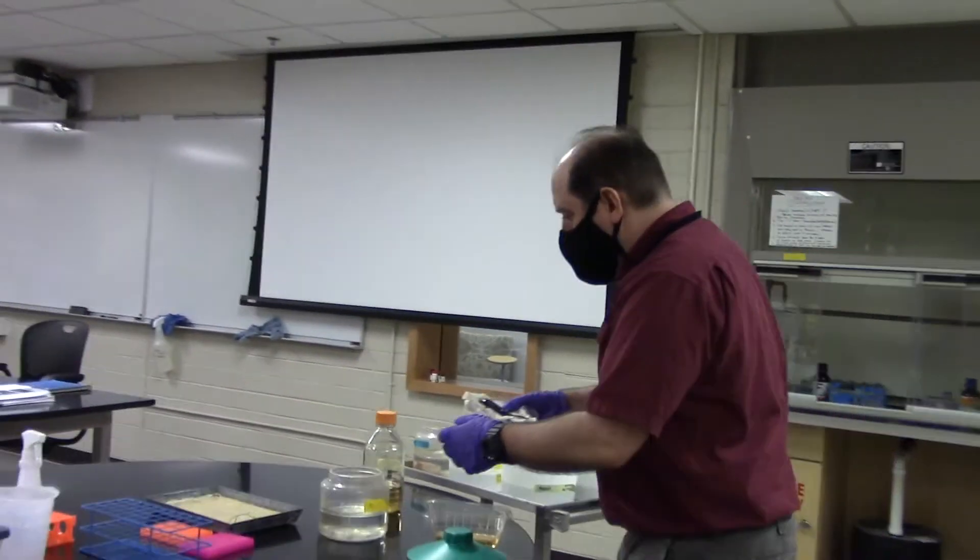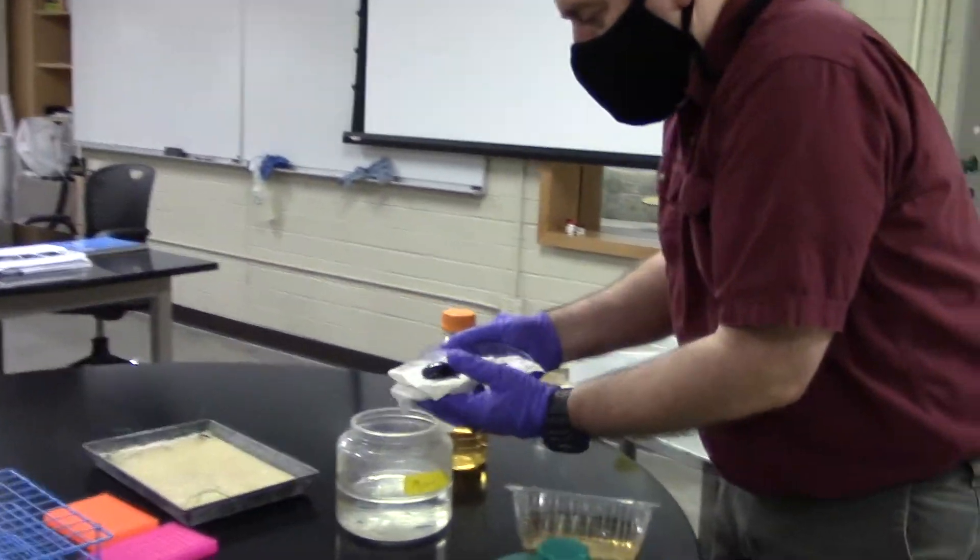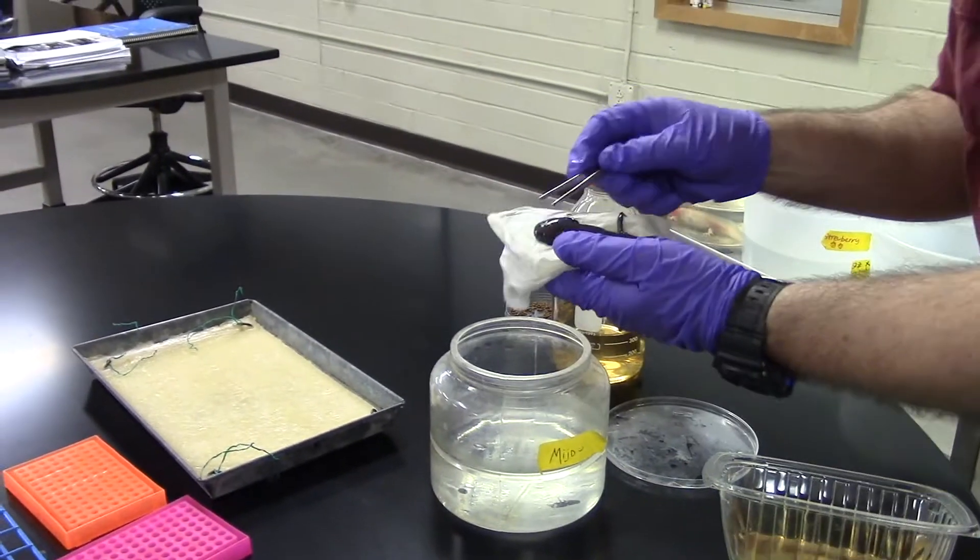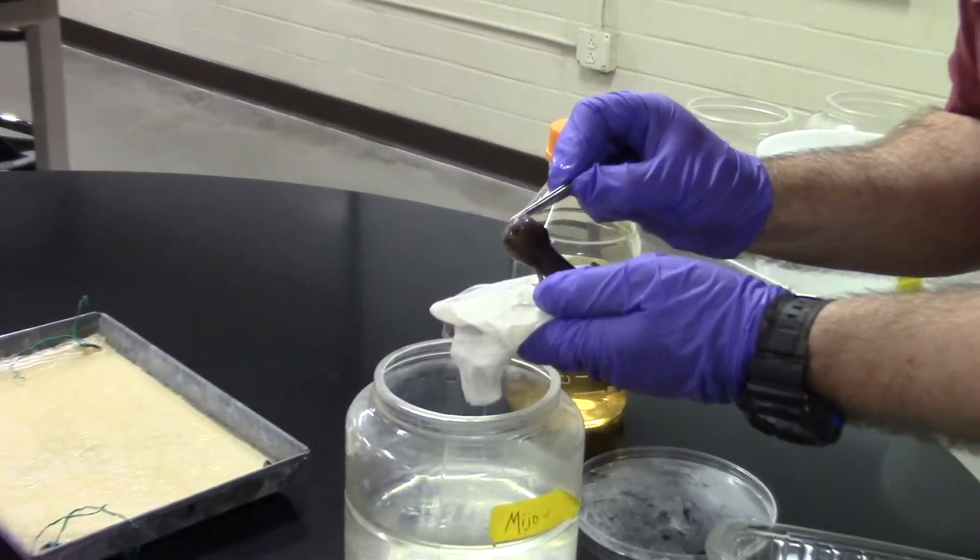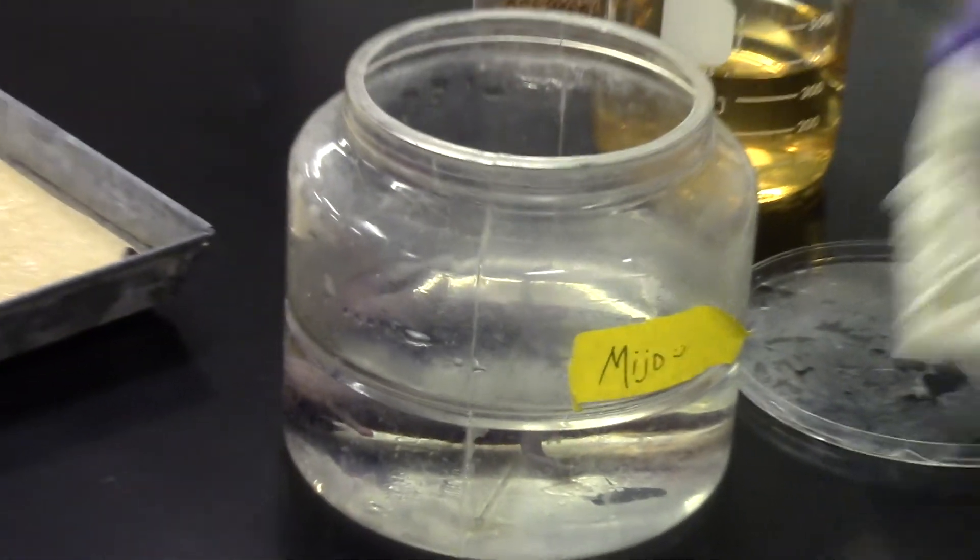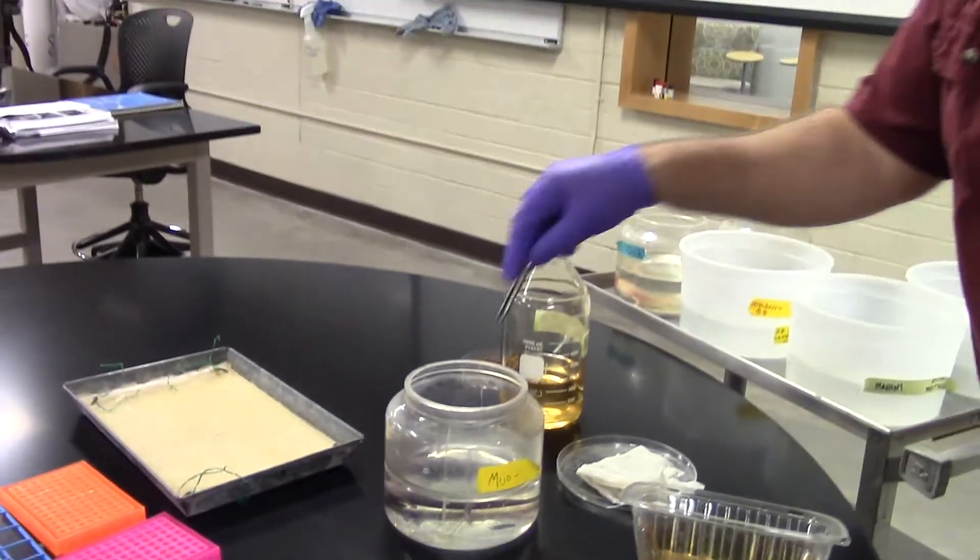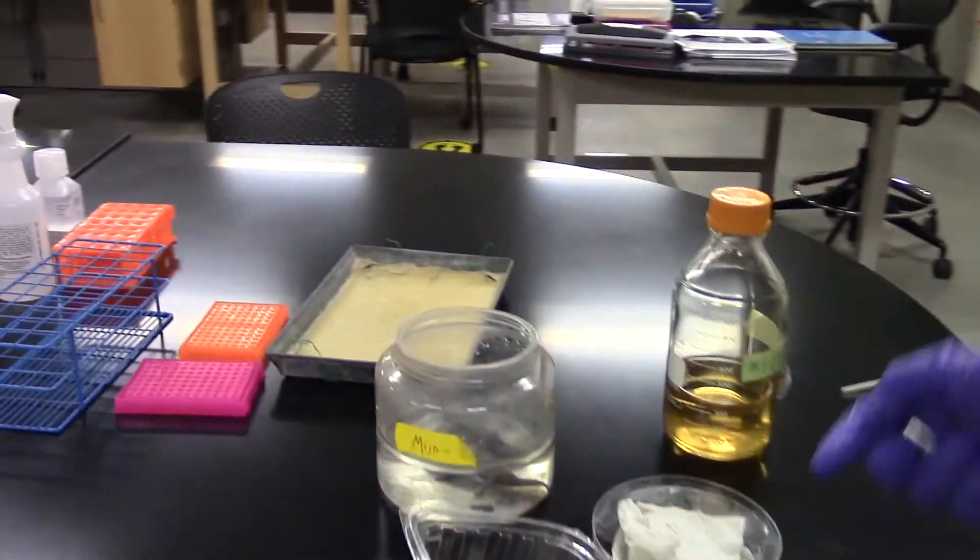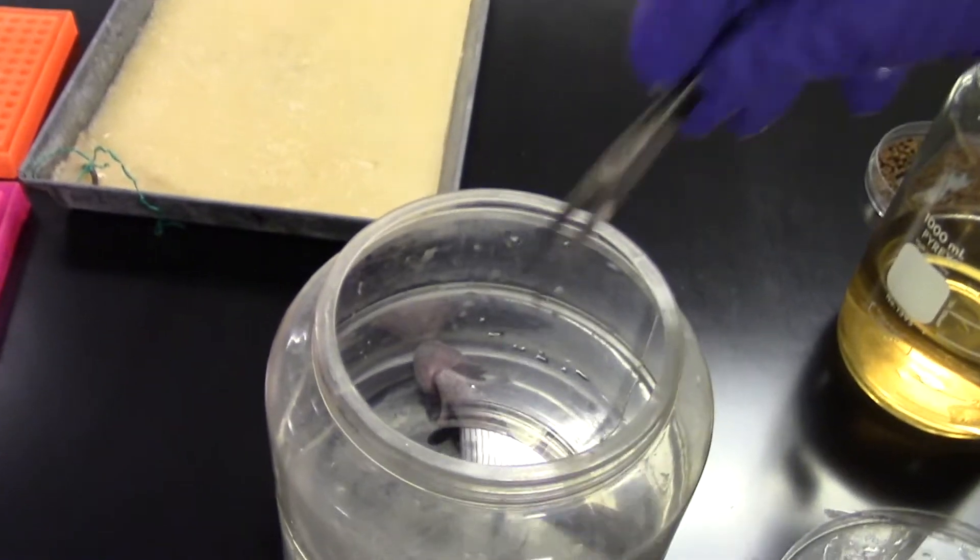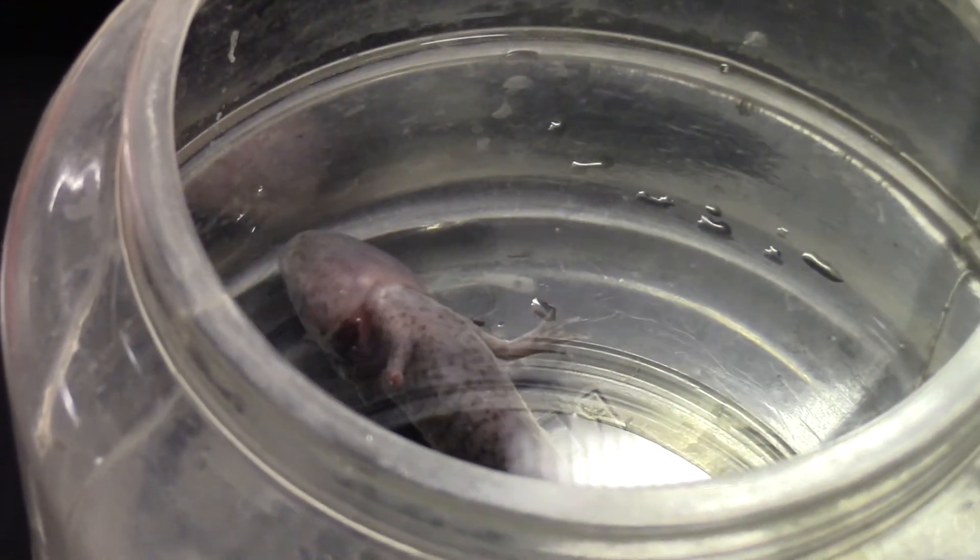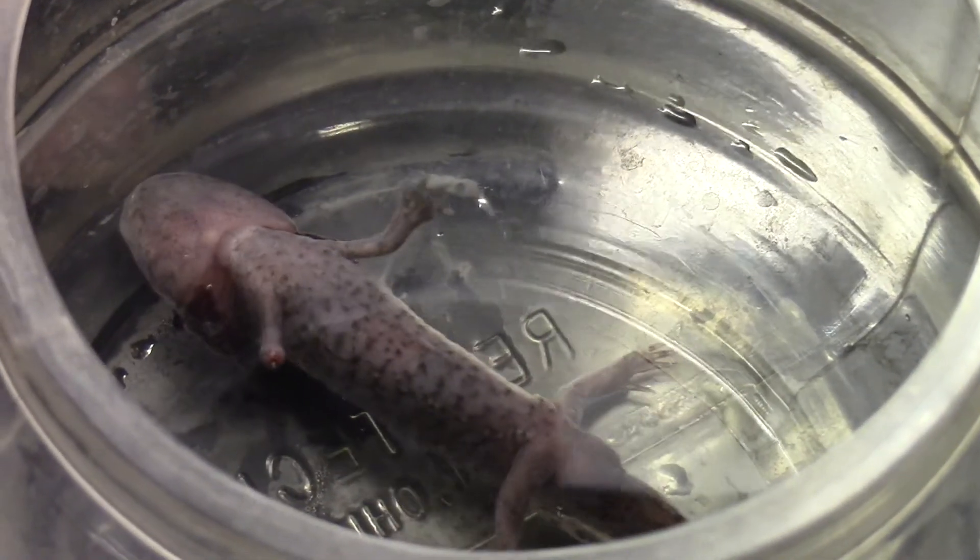So the last thing we'll do is as gently as I can. In fact, actually, I think I'll grab the operculum flap here and drop them back in the water. We'll carefully monitor him for the next. Oh, did you see that? The hand's already moving. Look at that. A little bit of motion back and forth. There we go. I didn't even have to touch.